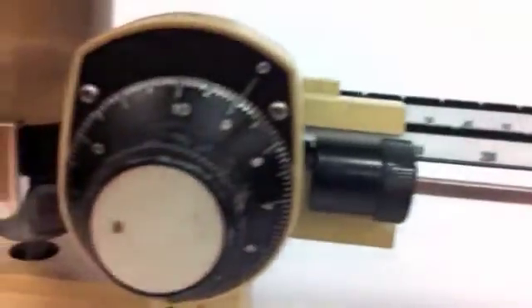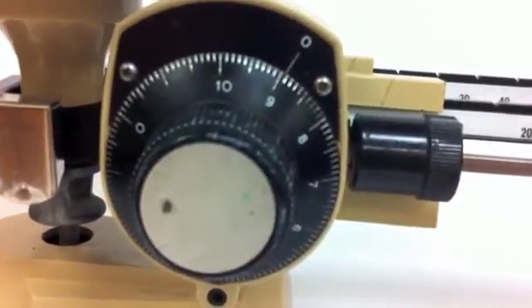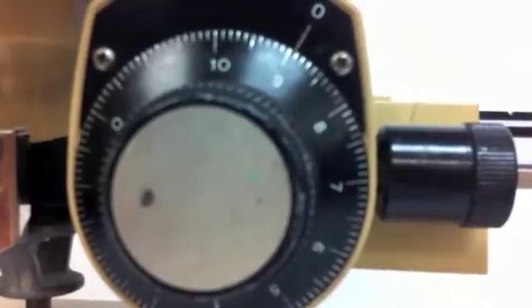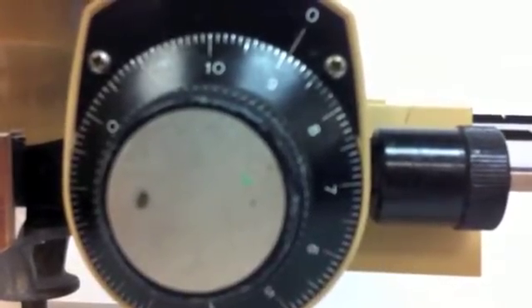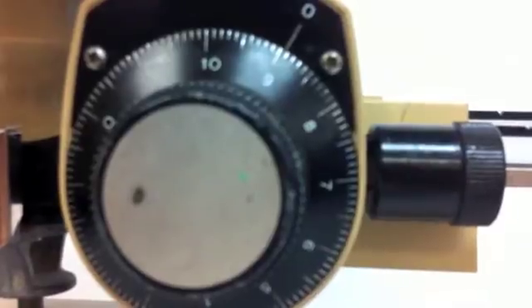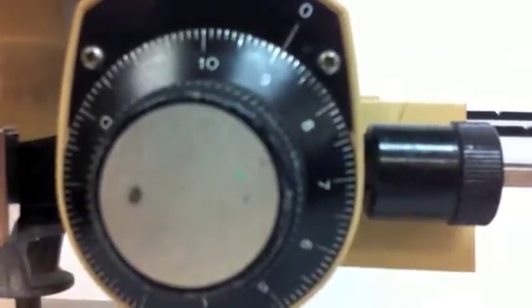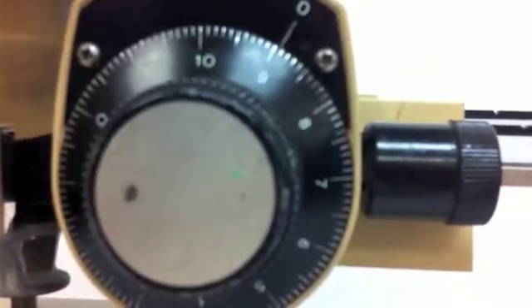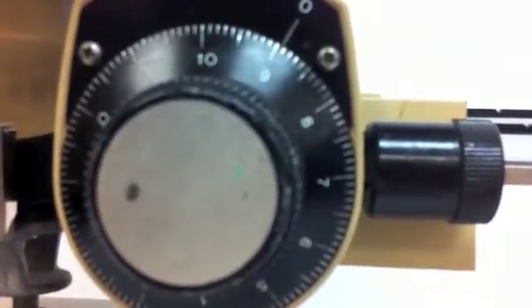Now again, it is lined up exactly at the zero point. My dial-o-gram is not quite nine. I'm going to say it's 8.95 grams. Then, don't forget, you're going to subtract the mass of the weighing paper, which was 0.45 grams. And that will give you the total mass of your red chemical.